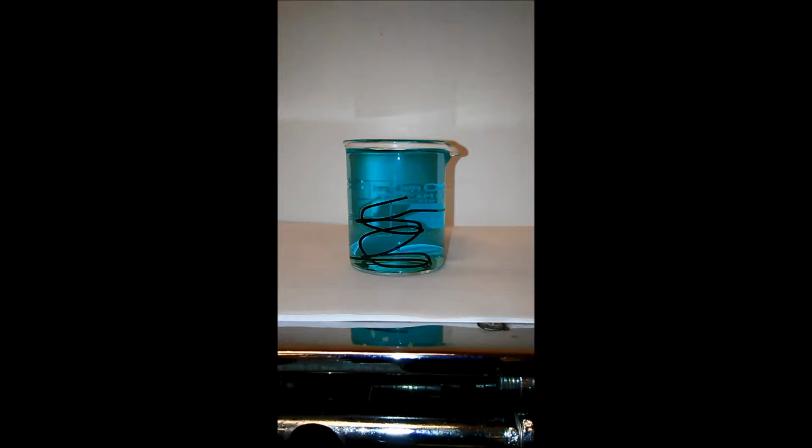The other thing is, just like this solution here changed color and went from clear to blue, this one here should do the opposite. It should go from blue towards a different color. Not necessarily clear. Iron solutions, depending on whether you have 2 or 3, will be either clear or yellowish. Yellowish, rustish looking color. So we'll have to check on it on Monday and see what it actually did, but I'll let these run over the weekend.